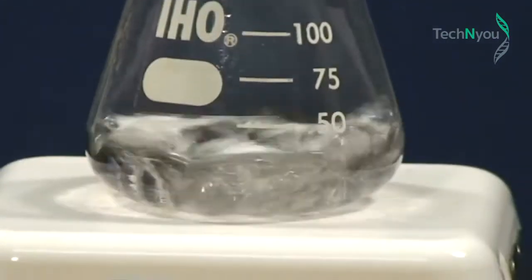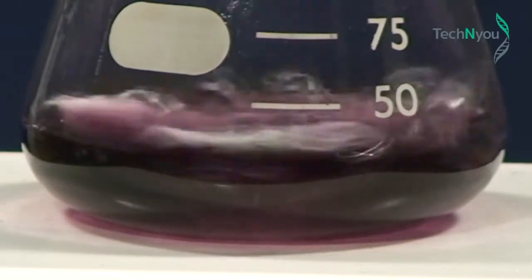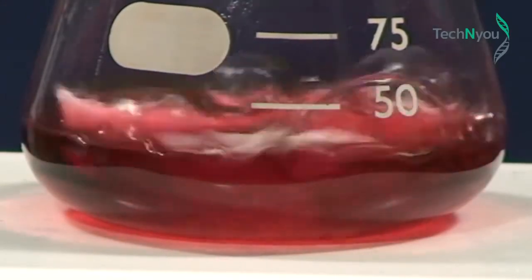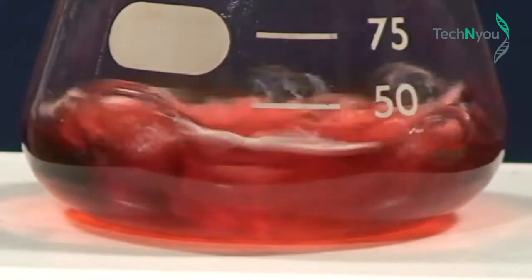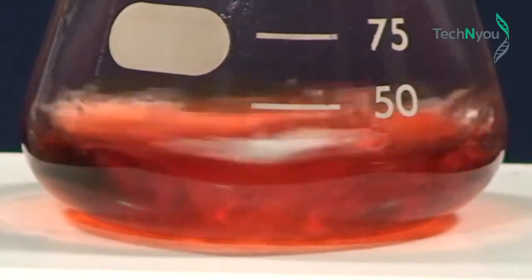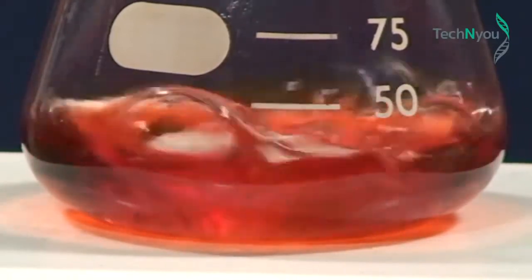You can see the colour change. It's gone from light gold through a blue colour phase. As we continue stirring, you can see the colour change again to bright red. The red colour indicates that we have produced nano-sized gold particles of around 10 to 20 nanometers in diameter, or colloidal gold. That is, gold nanoparticles suspended in solution.